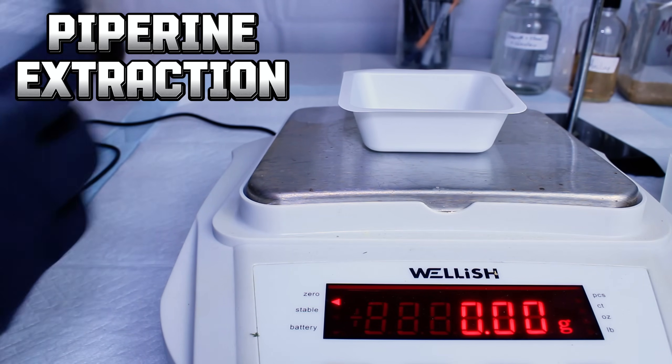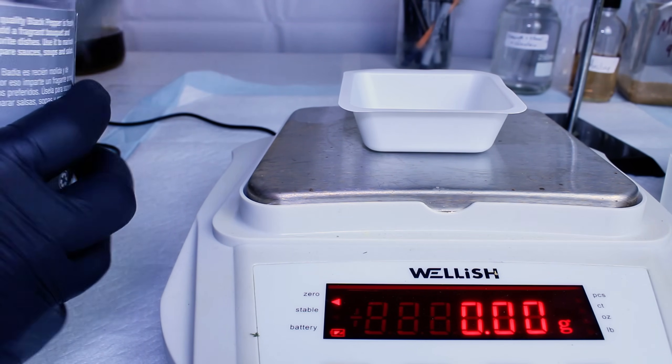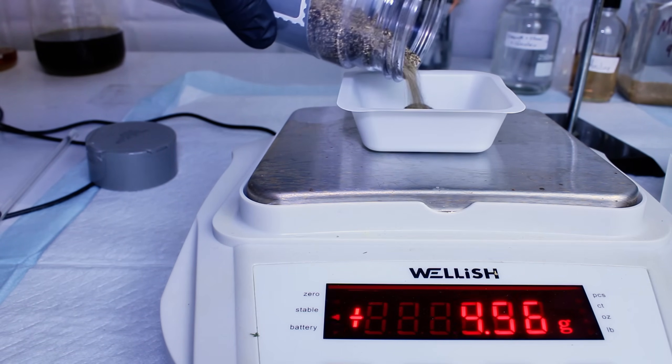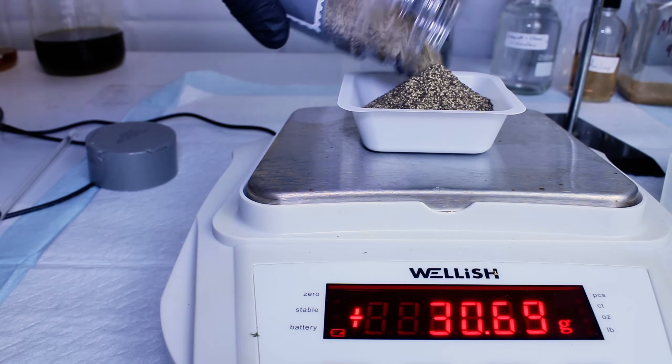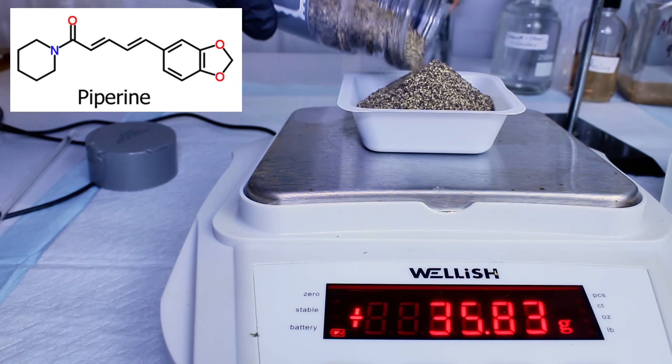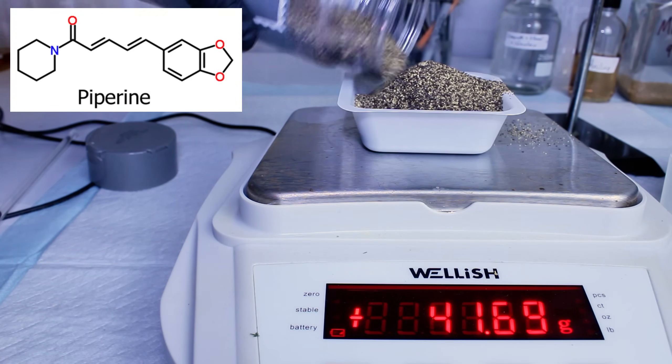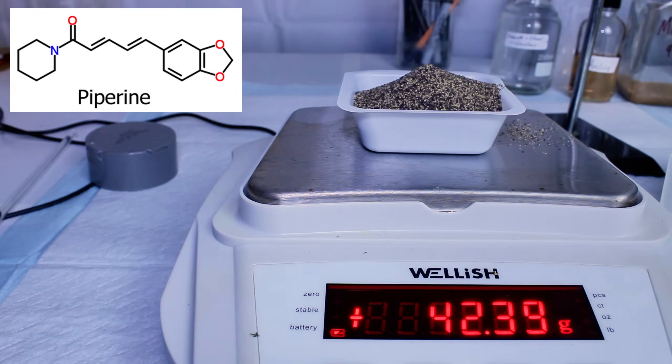Black pepper is one of the most common and widely used spices on earth, to the point that you would probably have a hard time finding a household that doesn't have any. The chemical primarily responsible for black pepper's unique flavor and aroma is called piperine, and today I'm going to extract some directly from black pepper.